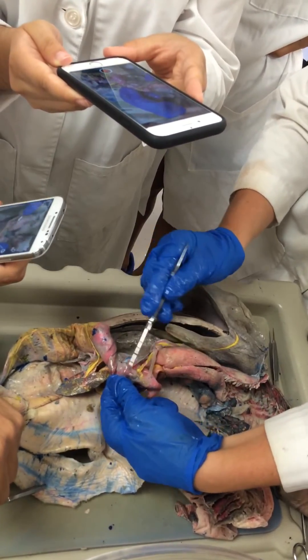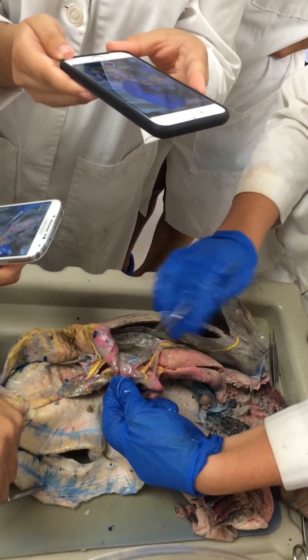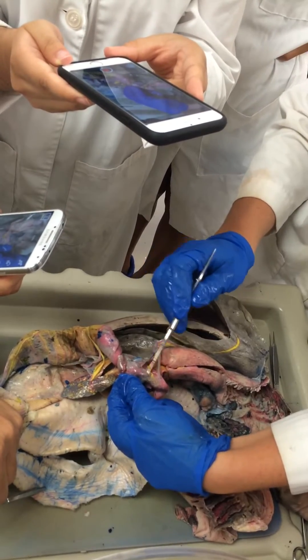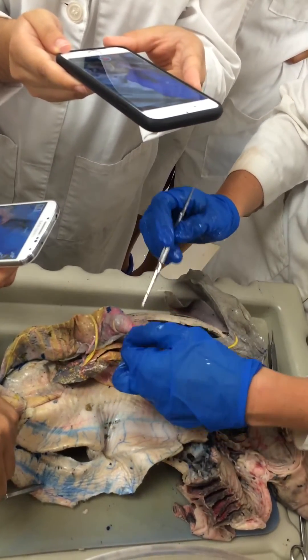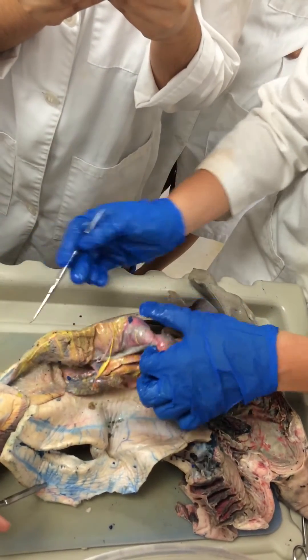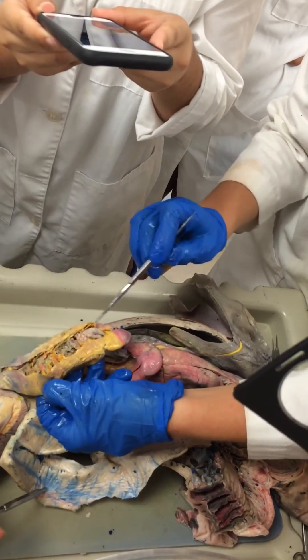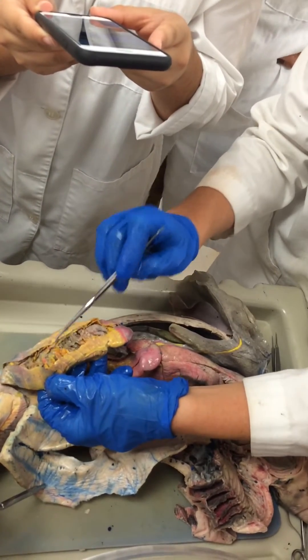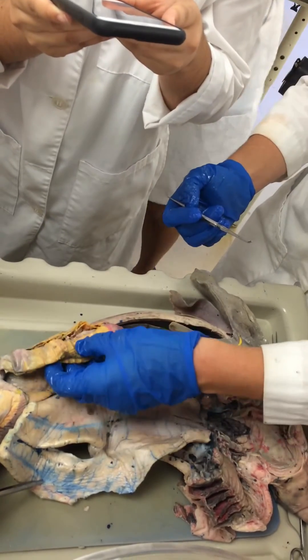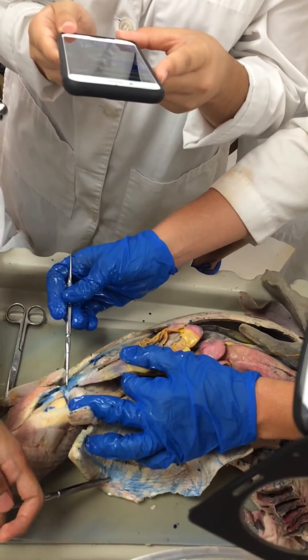This is all the small intestines the shark has — this is the duodenum, and it's pretty short. It doesn't have a jejunum and ileum like humans do. The next part of the digestive tract is this large valvular intestine, and it's got a spiral valve inside, where the food goes around and around all the way down. That really increases the surface area for absorption and time for digestion. And at the very end here we have the rectum.